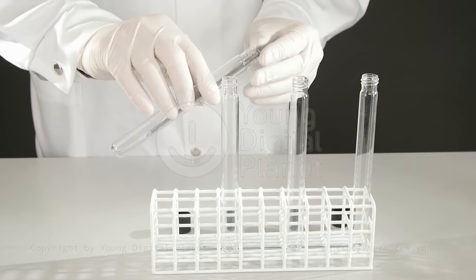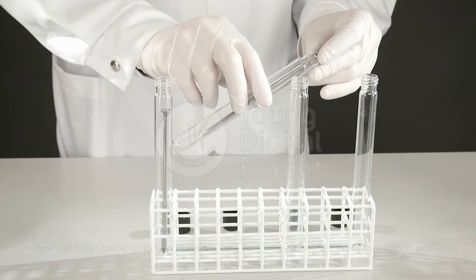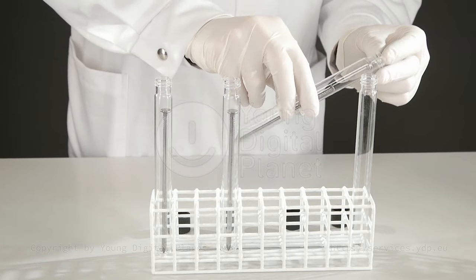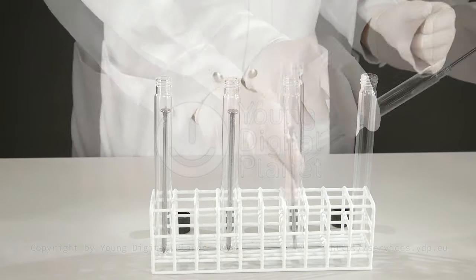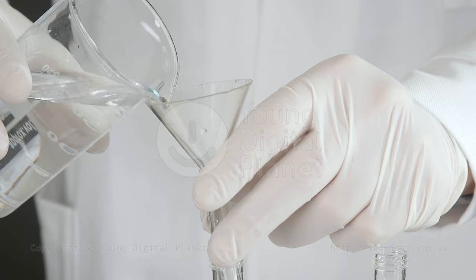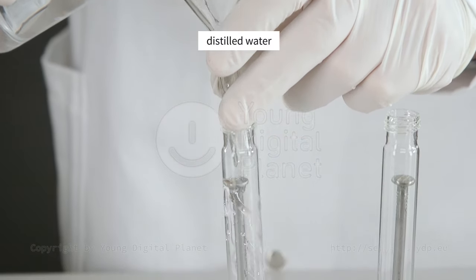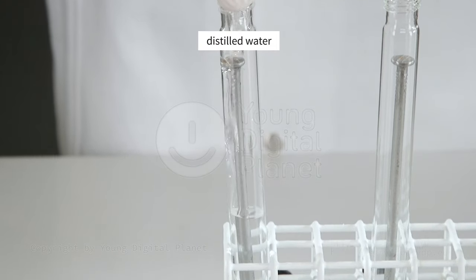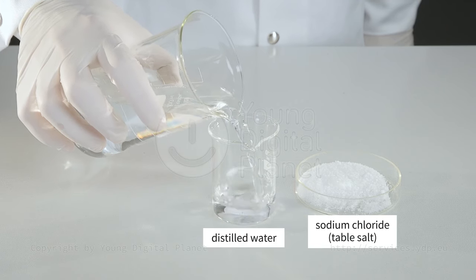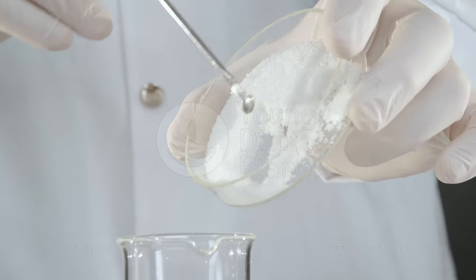We place nails in four test tubes. We add a little distilled water to the first test tube. We pour the water with some table salt into the second test tube.